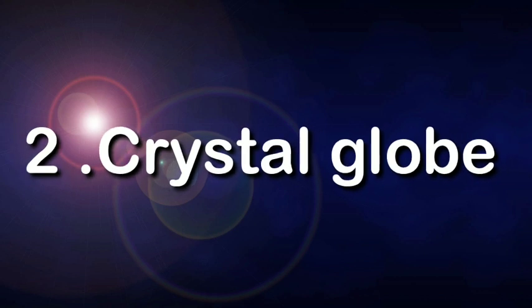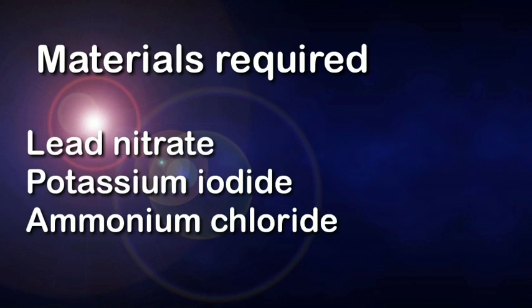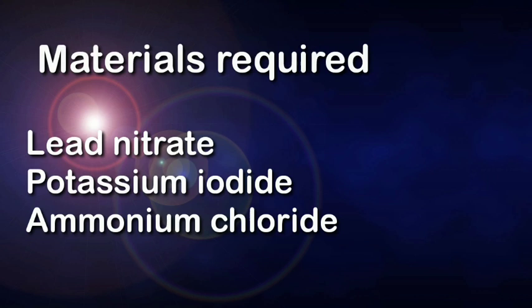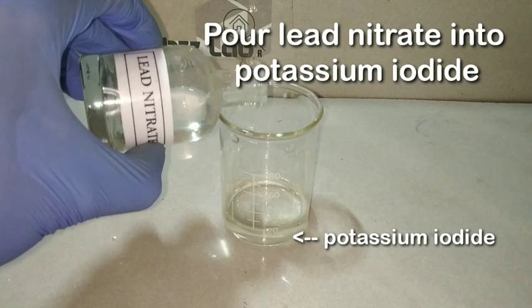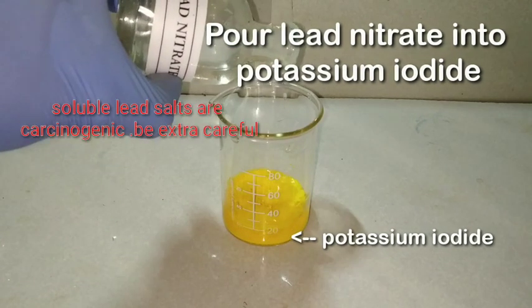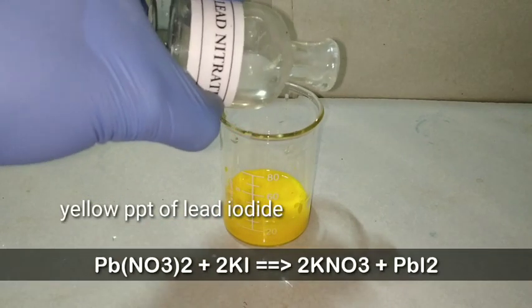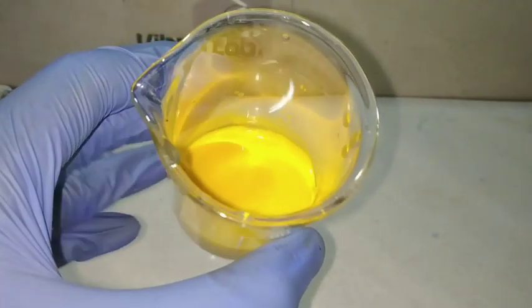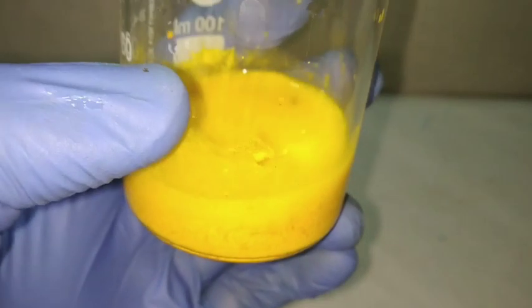The next experiment is to create crystal globes, and we will be using chemistry to make the crystals. The materials required are lead nitrate, potassium iodide, and ammonium chloride. Here I have taken potassium iodide solution into which I have poured lead nitrate. You can immediately see the formation of the yellow precipitate of lead iodide. To see more about this experiment you can watch one of my previous videos.